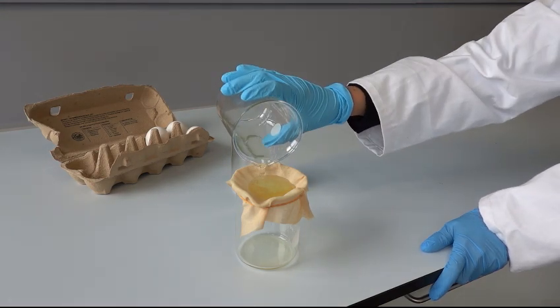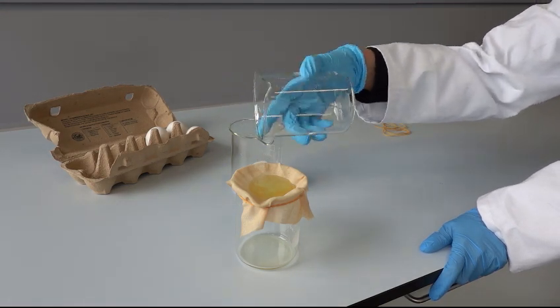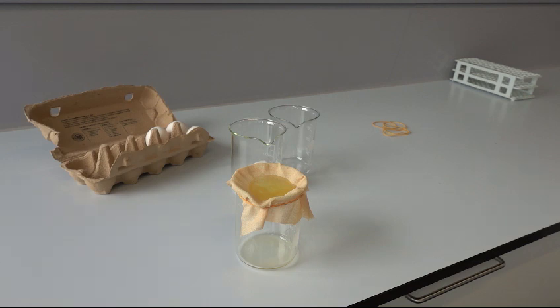Add the rest of the egg white. If too much viscous egg is left in the cloth, carefully remove the viscous egg white with a spoon. Wait another 10 minutes.